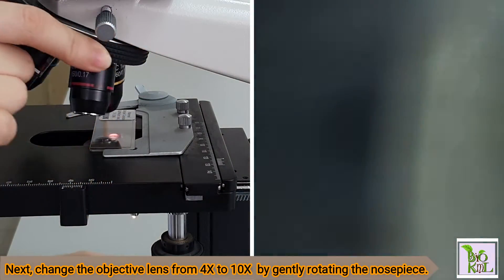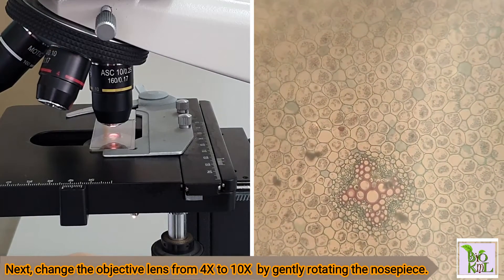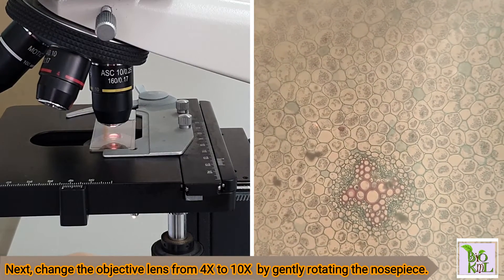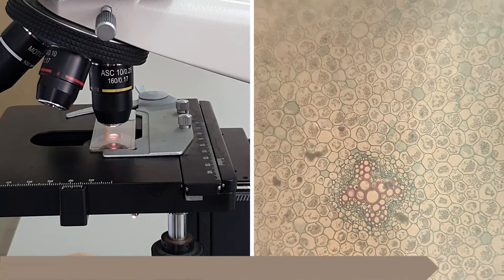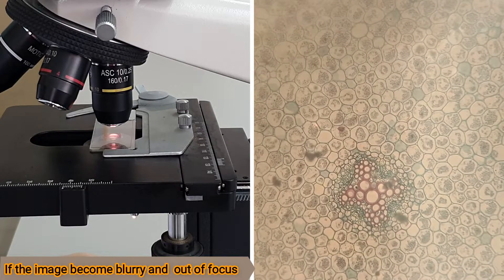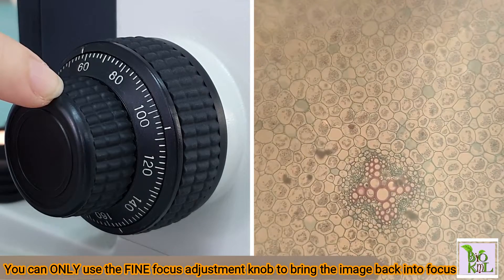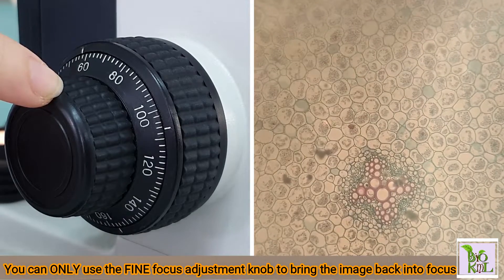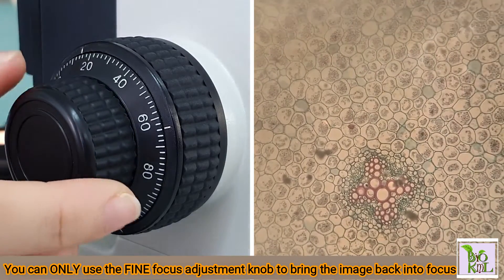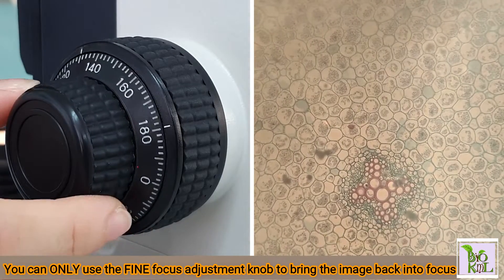Next, change the objective lens from 4 times to 10 times by gently rotating the nose piece. If the image becomes blurry and out of focus, you can only use the fine focus adjustment knob to bring the image back into focus.